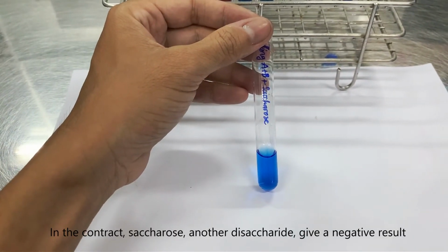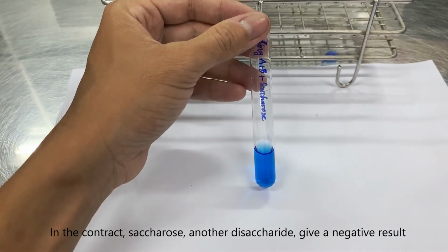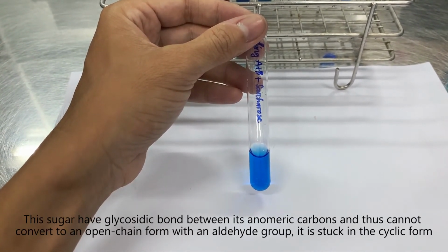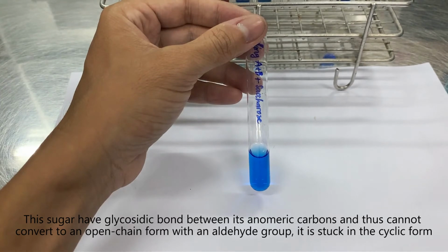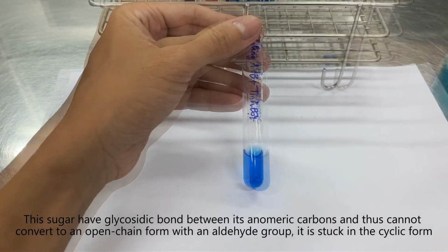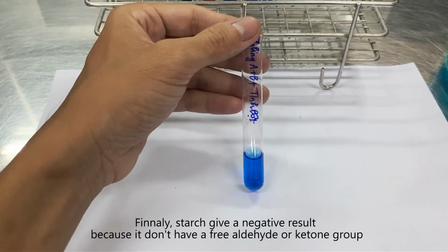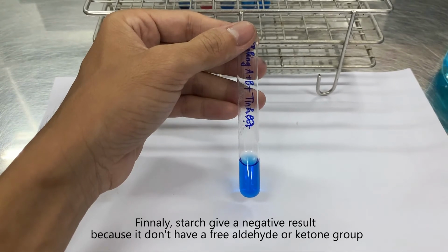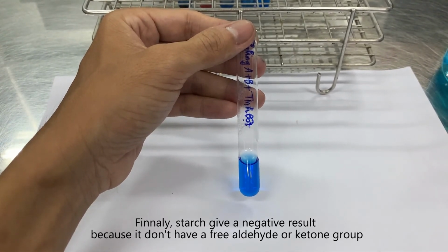In contrast, sucrose, another disaccharide, gives a negative result. This sugar has a glycosidic bond between its anomeric carbons and thus cannot convert to an open chain form with an aldehyde group. It is stuck in a cyclic form. Finally, starch gives a negative result because it doesn't have a free aldehyde or ketone group.